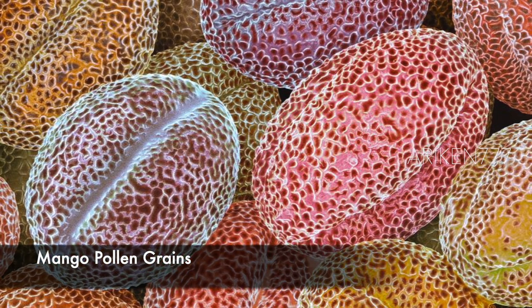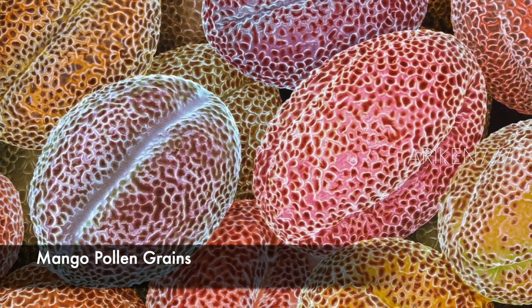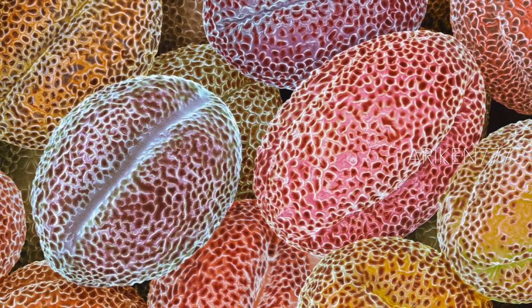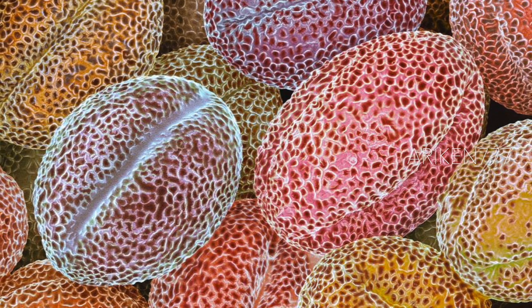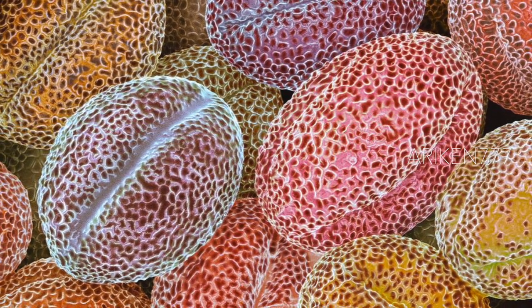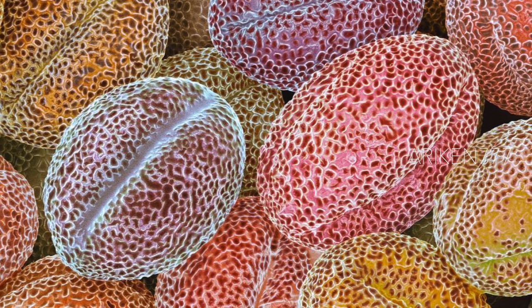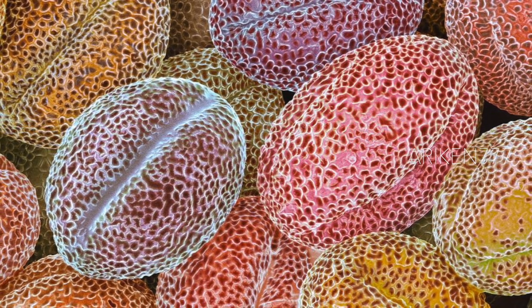These are pollen grains of a mango, which are edible sweet tropical fruits. Mangoes have been cultivated in South and Southeast Asia since ancient times.